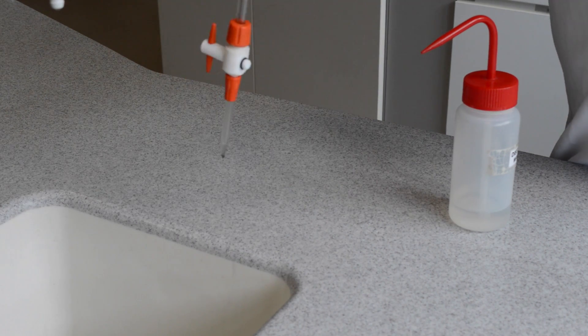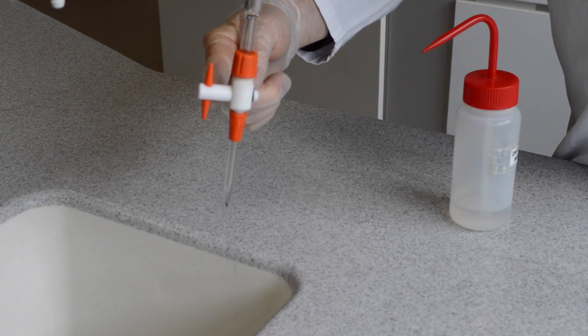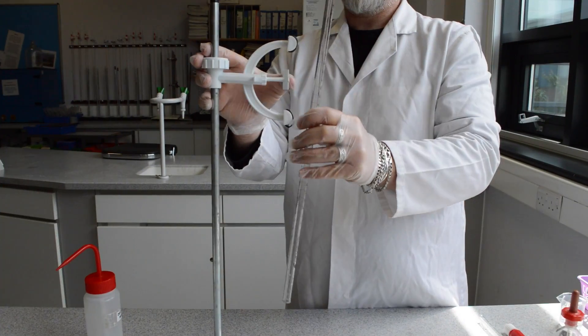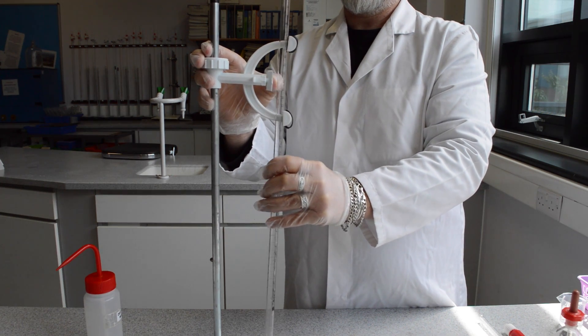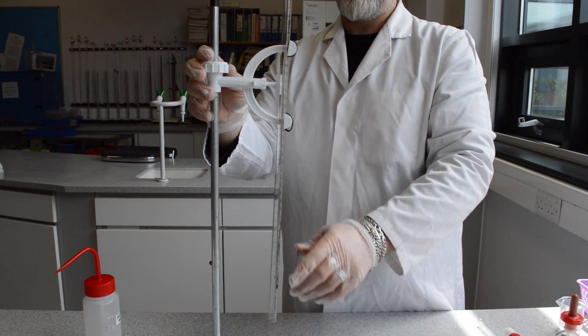When storing a burette on a burette stand or a burette rack, ensure that it is stored upside down with the tap open. Thank you.